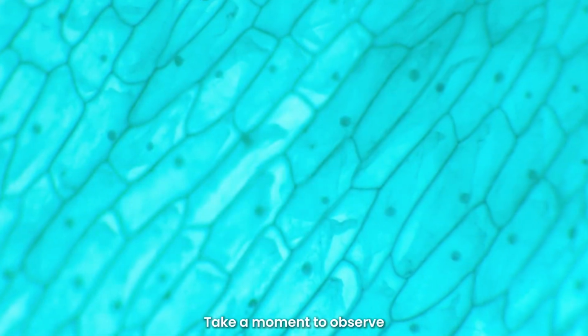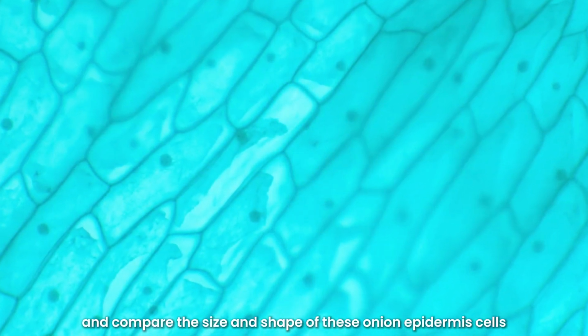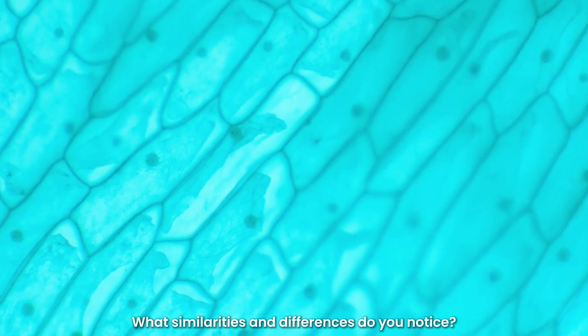Take a moment to observe and compare the size and shape of these onion epidermis cells. What similarities and differences do you notice?